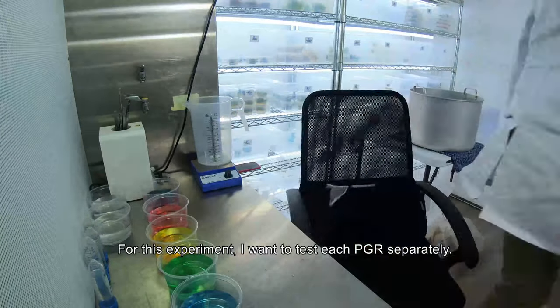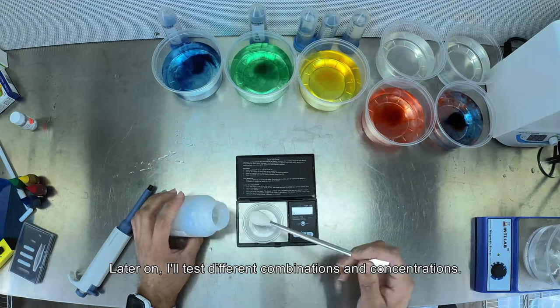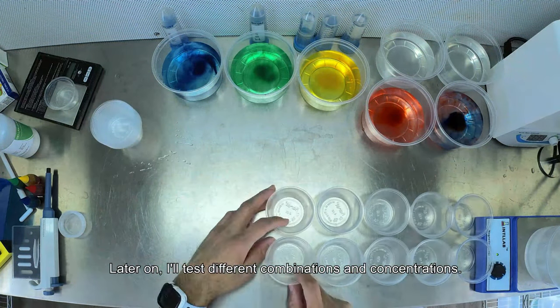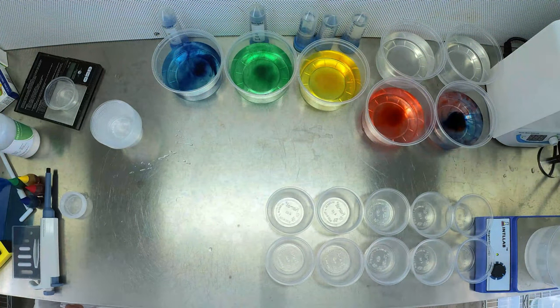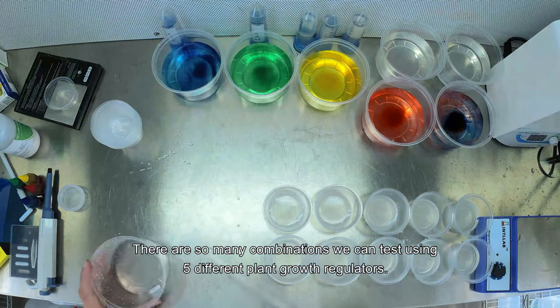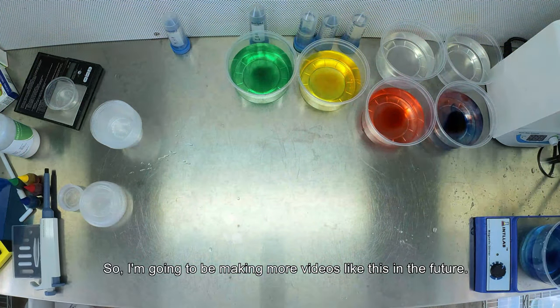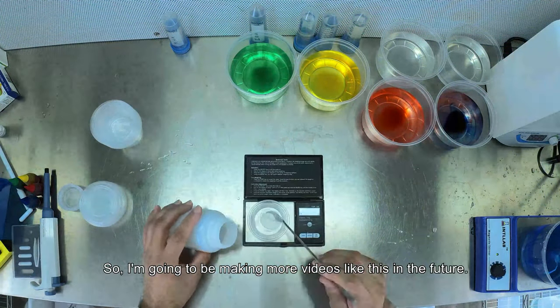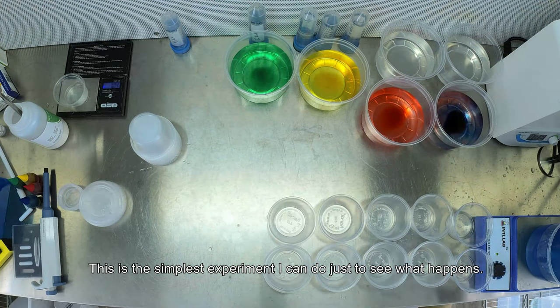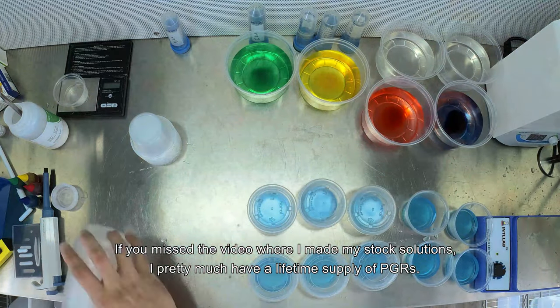For this experiment I want to test each PGR separately. Later on I will test different combinations and concentrations — there are so many combinations we can test using five different plant growth regulators. I'm going to be making more videos like this in the future. This is the simplest experiment I can do just to see what happens.